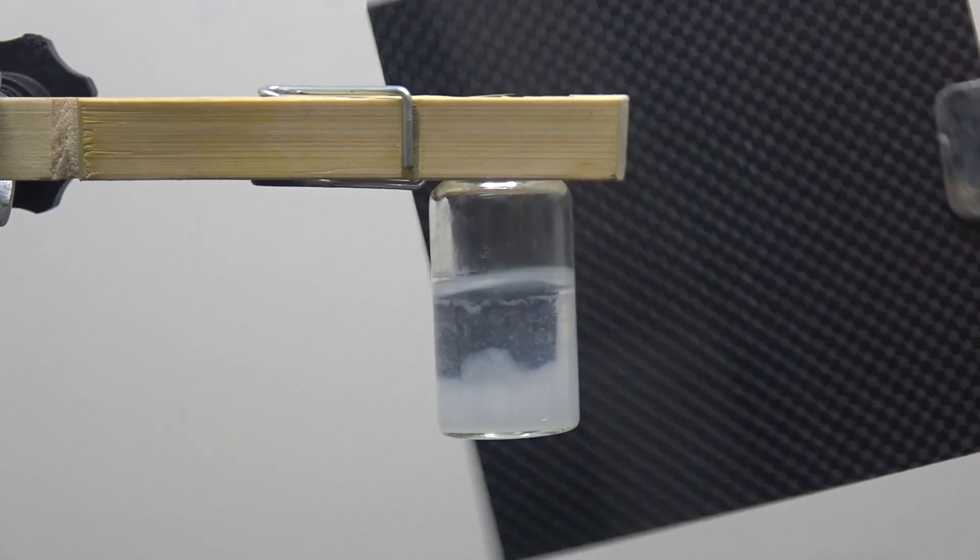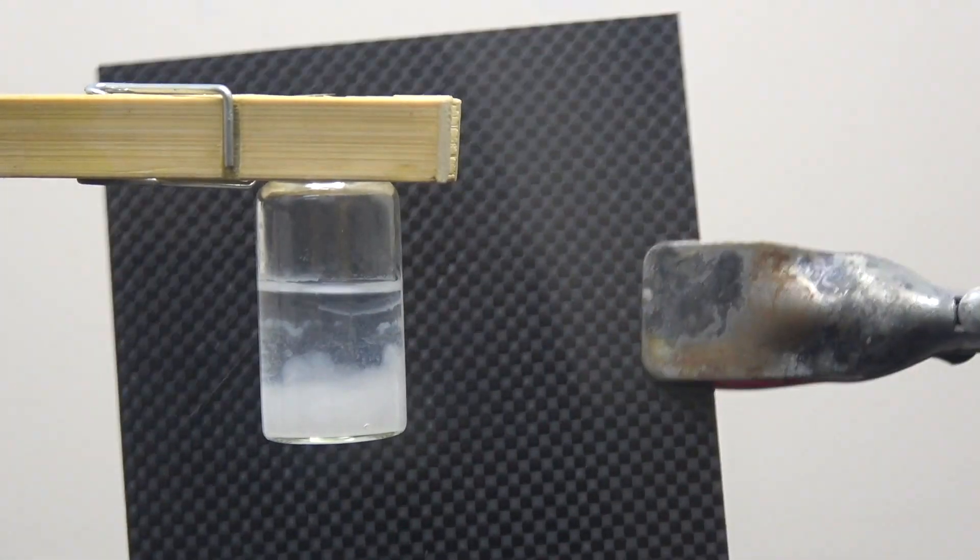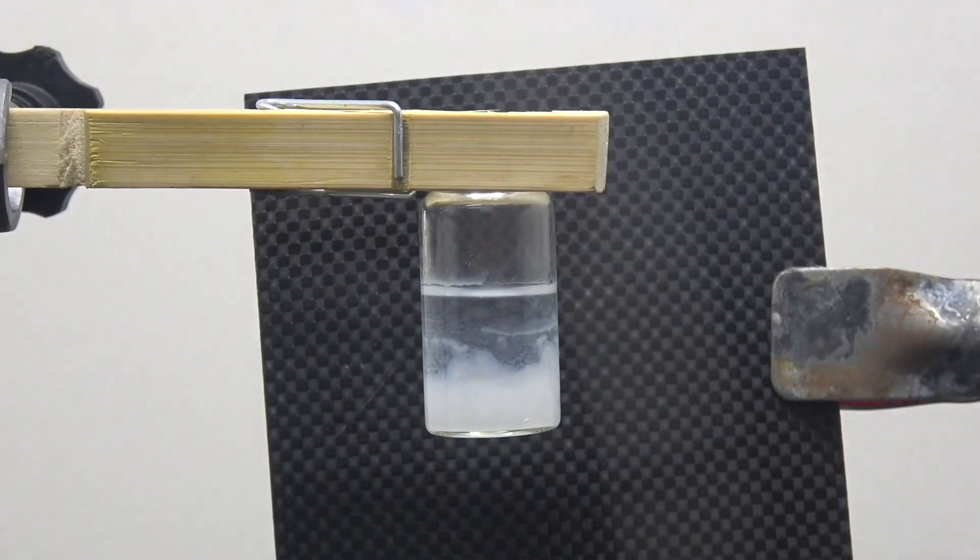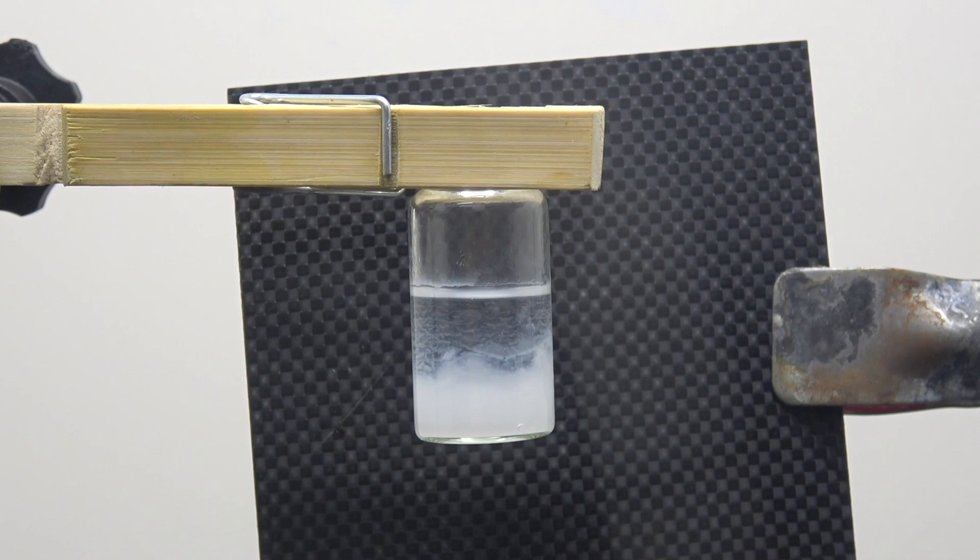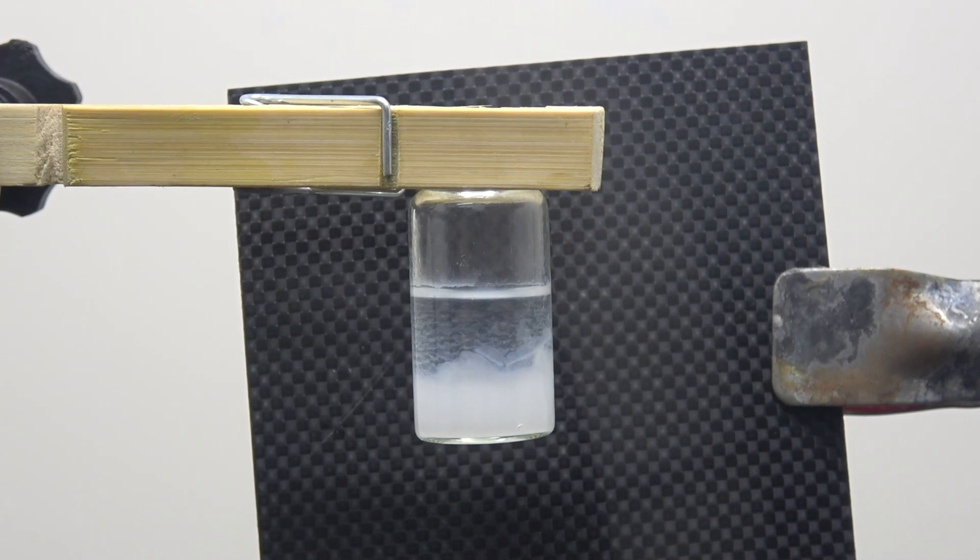Good thing I happened to have this piece of carbon fiber plate laying around, which was for another project that I thought never took off. But turns out it's gonna be handy after all.